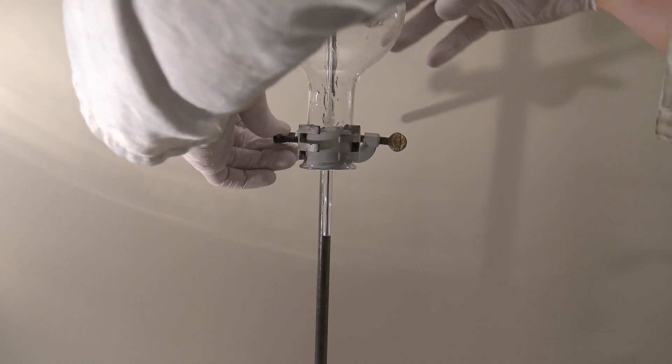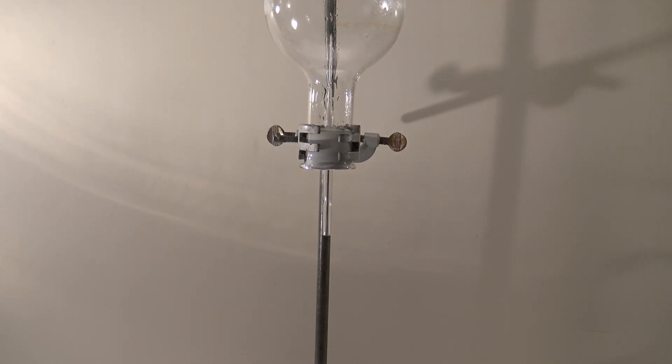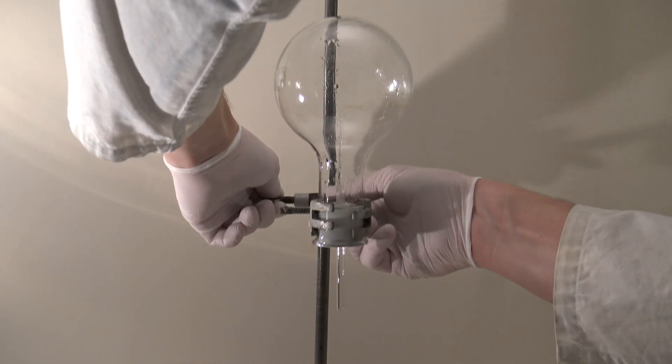A crystallizing dish is filled with water and placed below the flask. To the water a pH indicator was added.